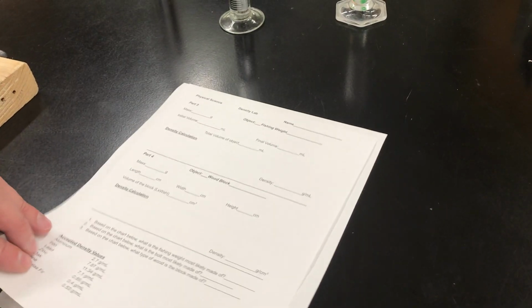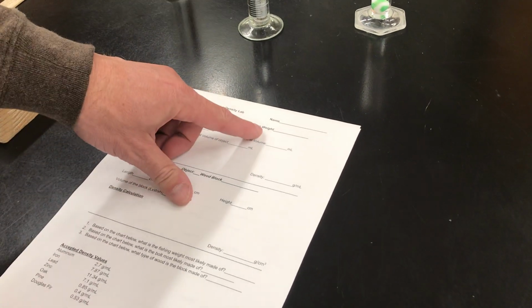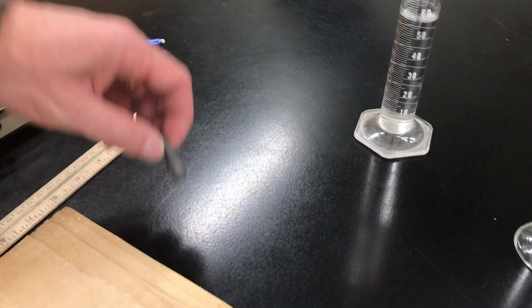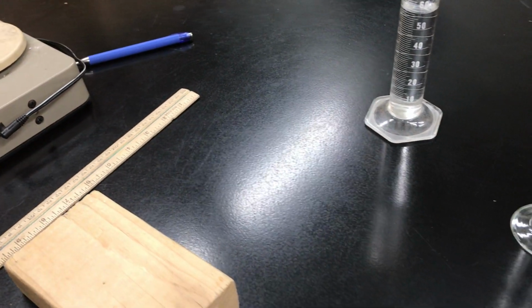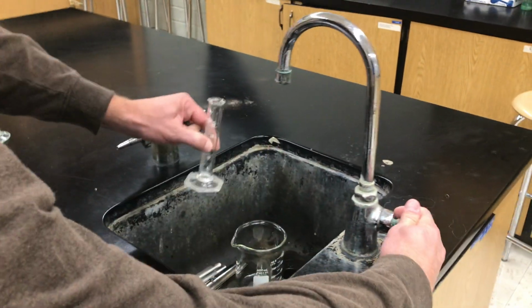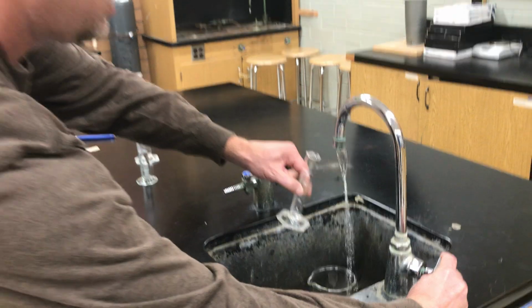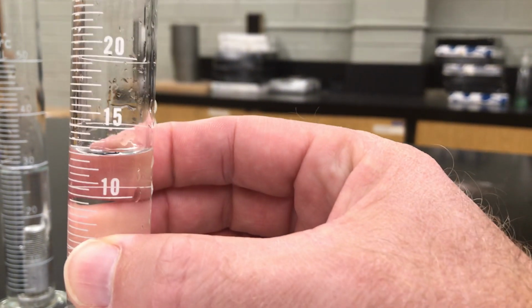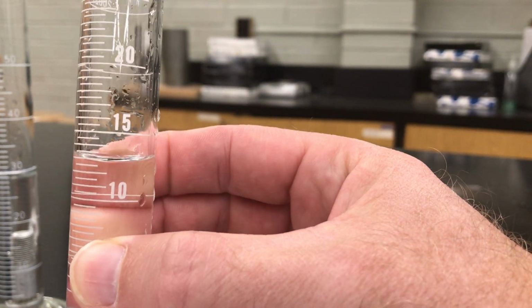Okay, now, let's move along and try a couple of other things here. You have a second side to this. We're going to take a look at a fishing weight. Now I look at these things and I go, which one should I use? I'm going to use the small graduated cylinder again. So I'm going to basically dump this out and put some water in. And a lot of people say, how much water should I put in? And the answer is yes. Put in some water. It doesn't matter how much it is, as long as it's enough to submerge the fishing weight. Okay, I don't care where it starts, I care how much it changes.